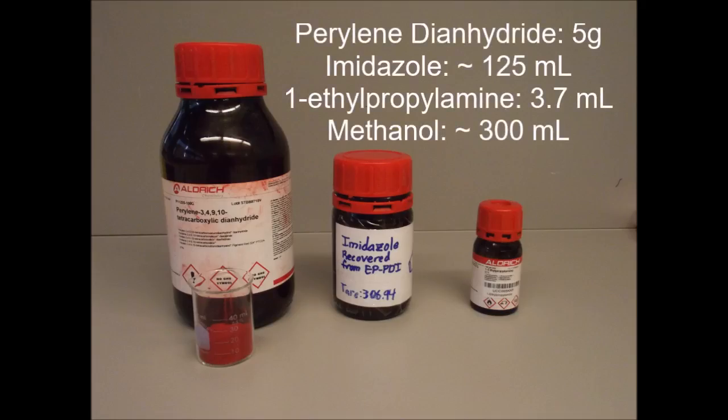This reaction requires four materials: perylene dianhydride, imidazole, ethylpropyl amine, and methanol.